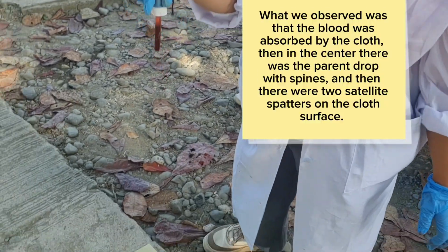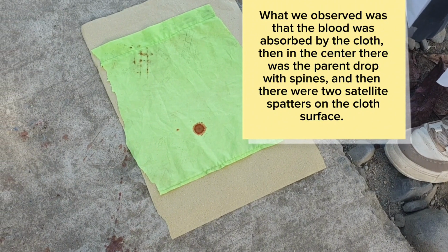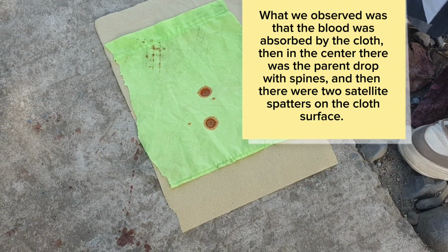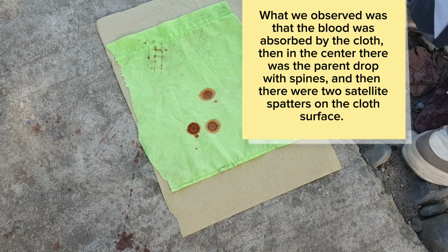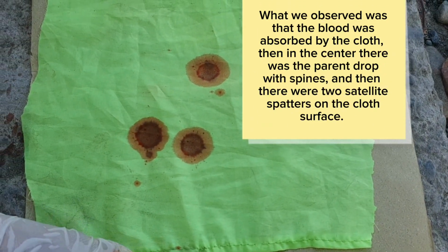Clothing. What we observed was that the blood was absorbed by the cloth. Then in the center, there was the parent drop with spines, and there were 2 satellite spatters on the cloth surface.